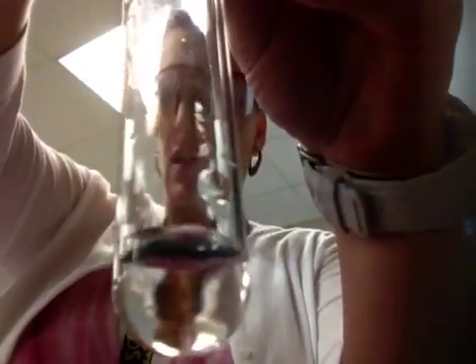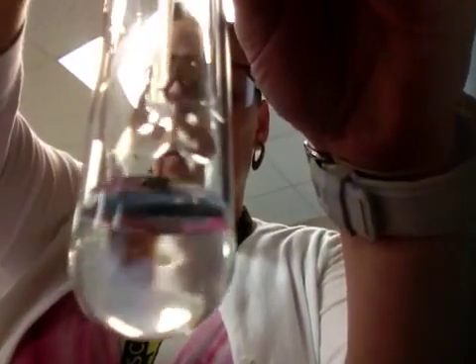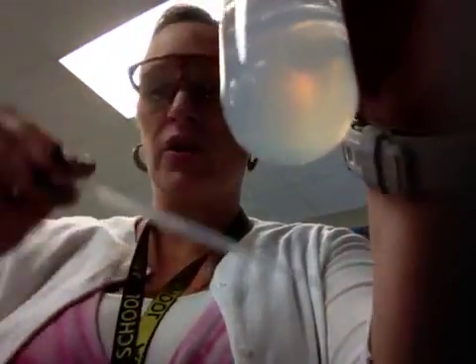When I combine them, instead of getting a clear liquid, it turns cloudy and white. Now, if I let this sit for a little while, something really cool happens.